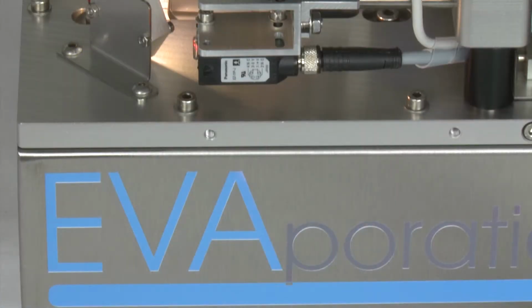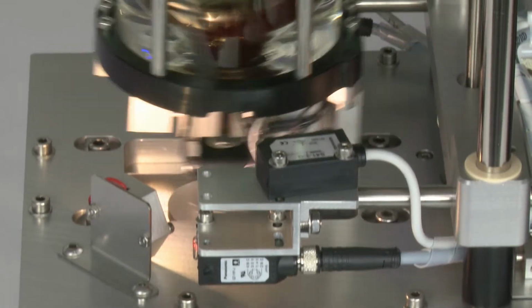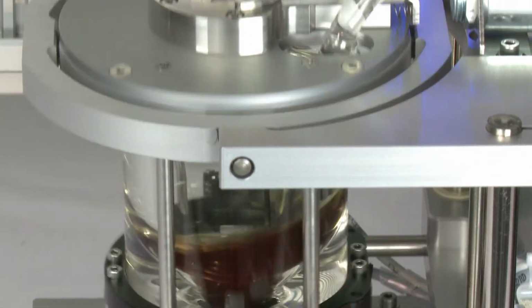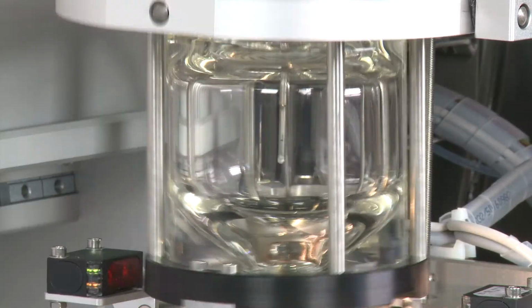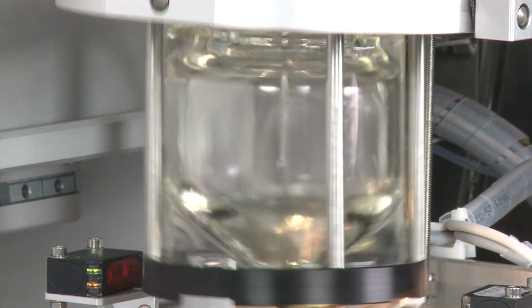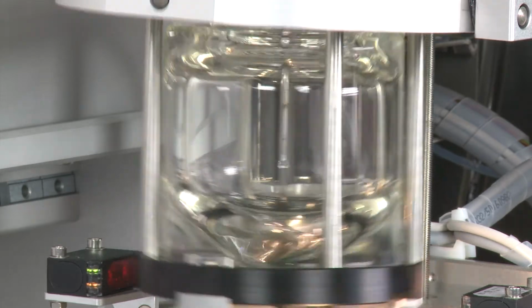A solvent exchange is done either by direct liquid-liquid exchange or by the evaporation of the sample to dryness and resuspension in a different solvent. The rotation in the chamber effectively prevents boiling retardation. The robot needle takes up and transfers the concentrated sample without any losses. Rotation also supports the cleaning of the chamber. This prevents cross-contamination between samples.